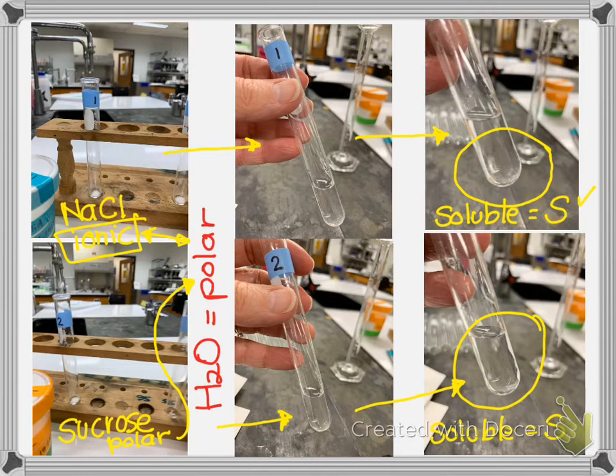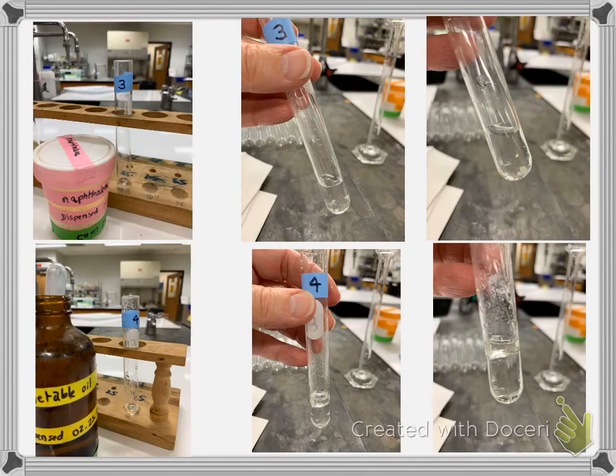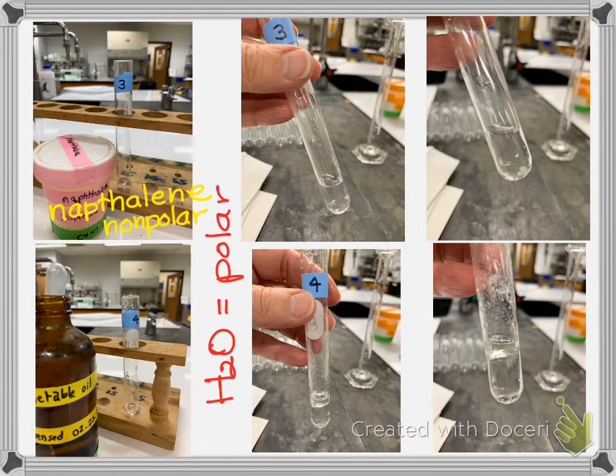Now I'm going to go through the ones specifically with water with you, but then when we go to the other ones, I want you to try to do it. So here's naphthalene. This was the hydrocarbon, and remember hydrocarbons are nonpolar. Again, this is the water that we're doing. We had 4 solutes, and the first 4 we did all of them, we added water to them. So water is polar, just as a reminder.